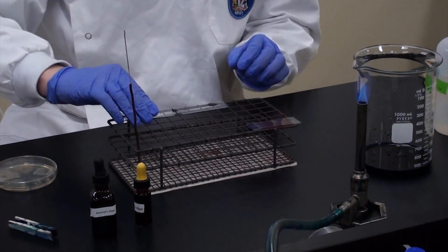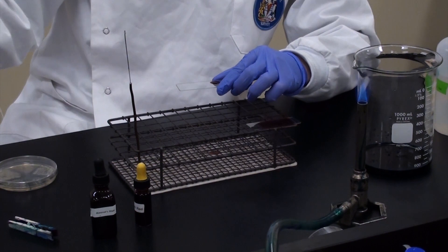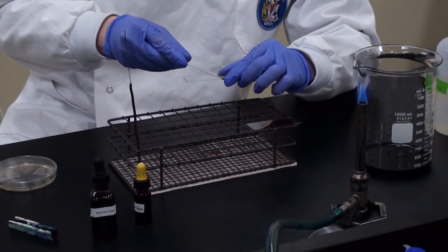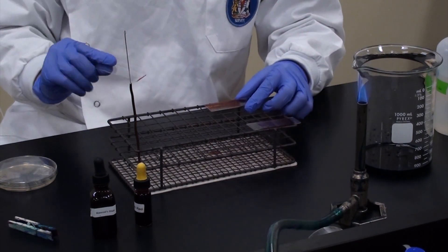Put your loop like that. Get your slides ready. 45 degree angle. Back it up. Let it run across. And quickly slide. Just like that. Awesome.